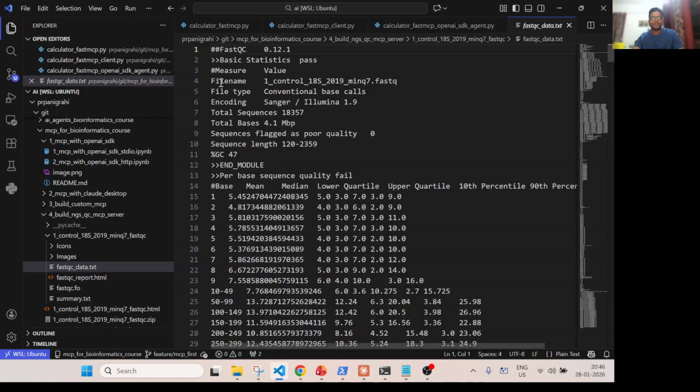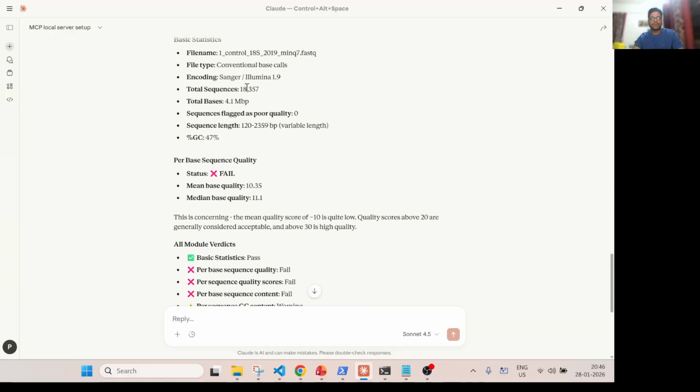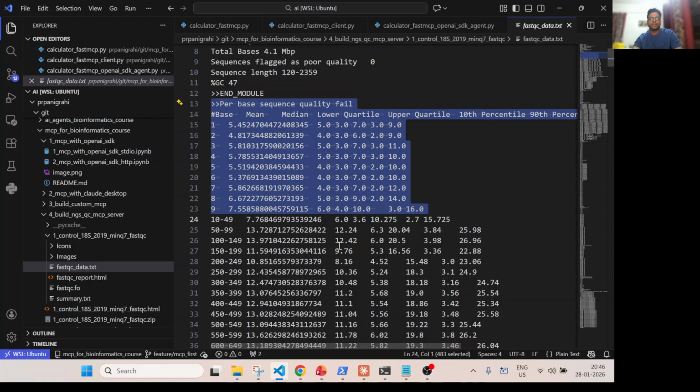Okay, so this is the overall basic statistics you got, right? Just remember this number 18357, you will see the same number. 18357, 4.1 million base pairs, and 120 to 2359. So whatever the information was there from this block, I wrote a Python function to extract it, and the same one, the agent did it. Then I also did this block, second, per base sequence quality.